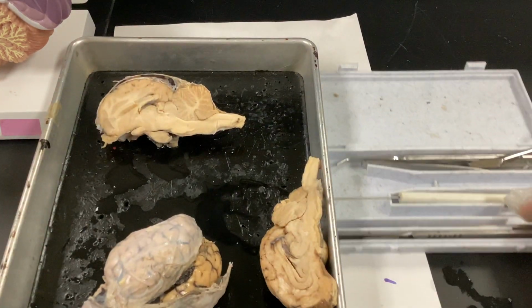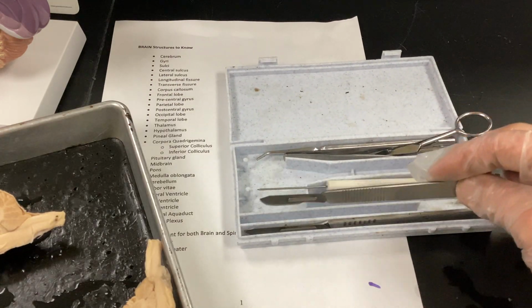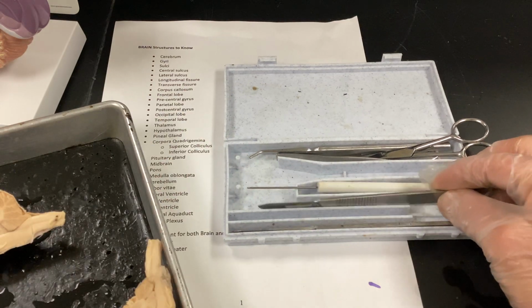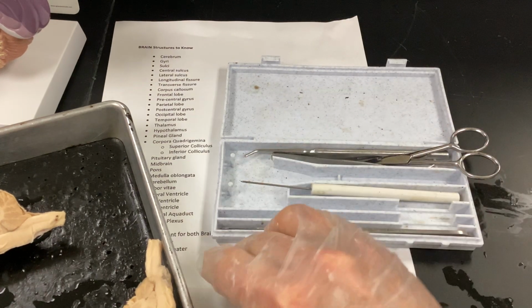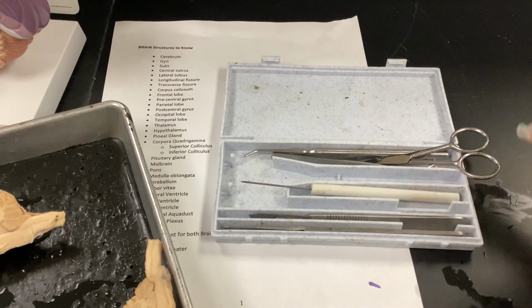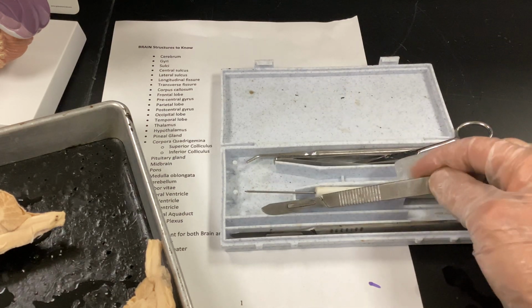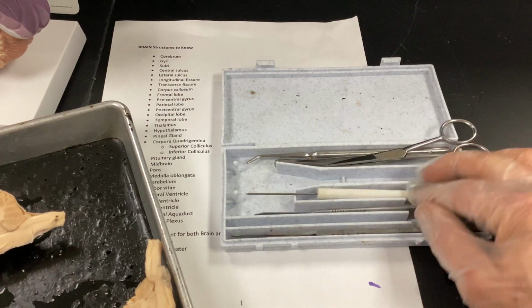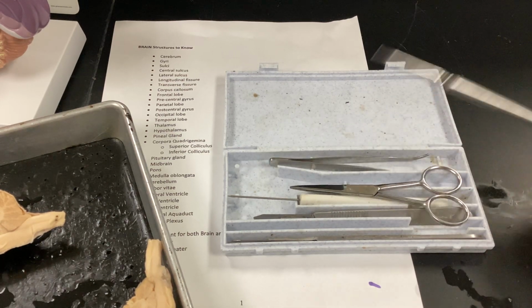Assuming that this instructor didn't tell the students how to put this away, but here's your kit. Make sure the blade is down, all right? And these go in here. The handle should be here, so when I reach in, the other day I saw one like this. Blade was up, so when the student or myself went to grab it, you potentially cut yourself. But anyway, it's a number 10 blade, really tiny. Number 22 blade, a little bit bigger. We'll use this probe if we need to, point out some structures, or some scissors if we need to cut.